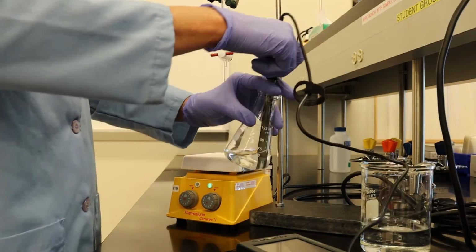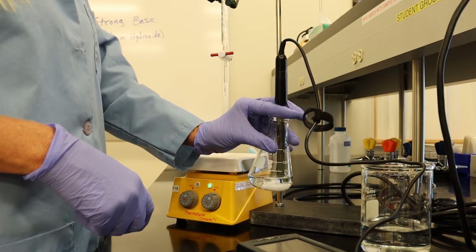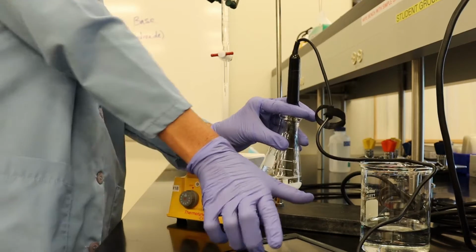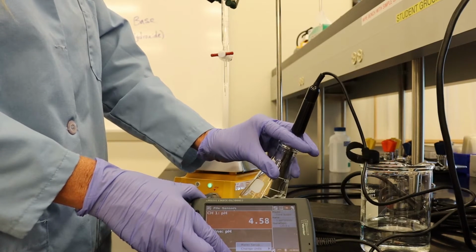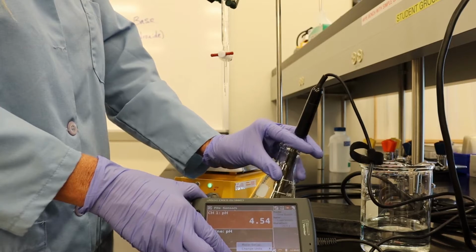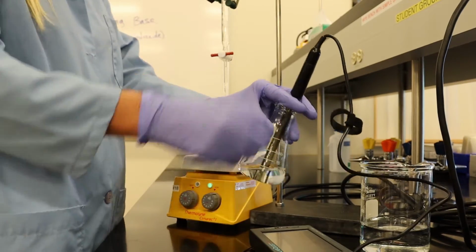Looks like our pH is fluctuating between 4.5 and 4.6. So let's go with 4.5. Let's go with 4.6. A little average there.